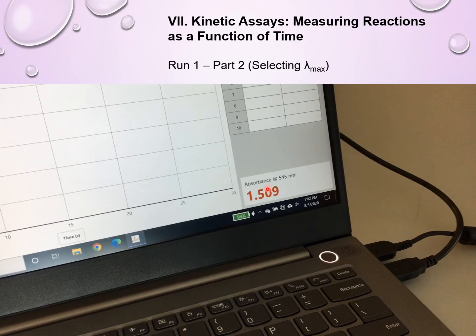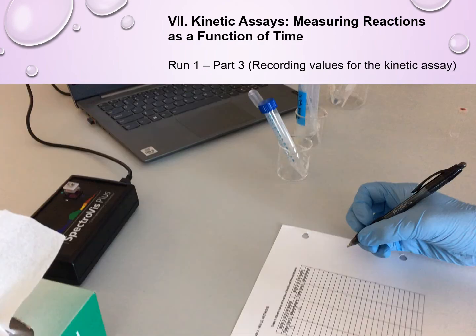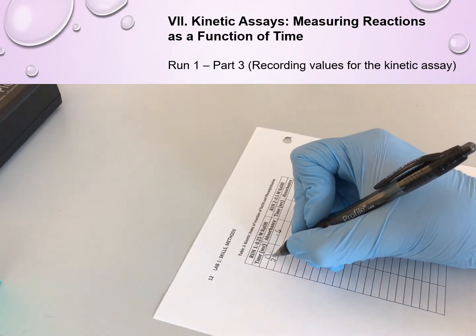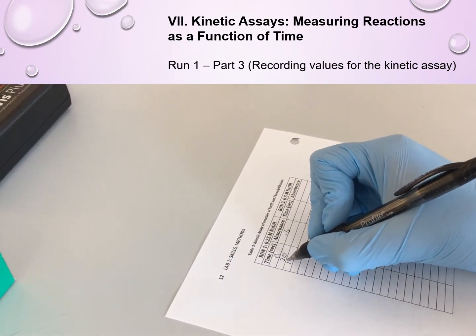545 nanometer wavelength. Okay, so at the time we stopped the video, the absorbance of our sample happened to be 1.509 at our lambda max value of 545 nanometers. So in this next installment, what we are now ready to do is to actually do our kinetic measurements.